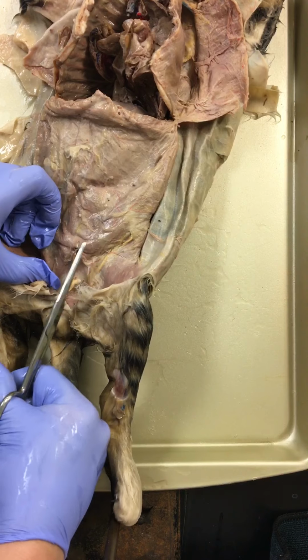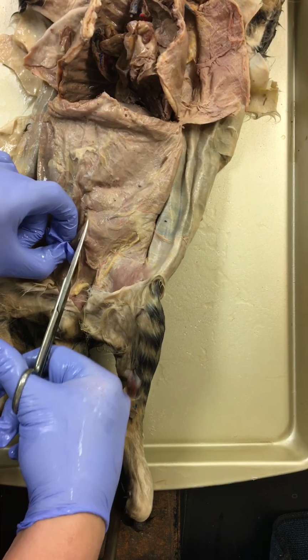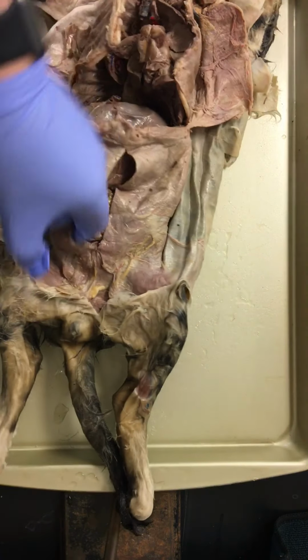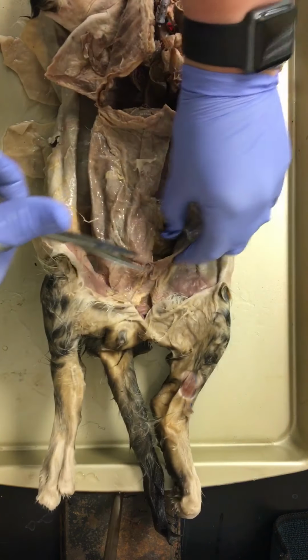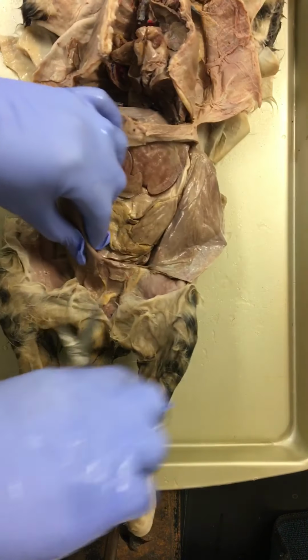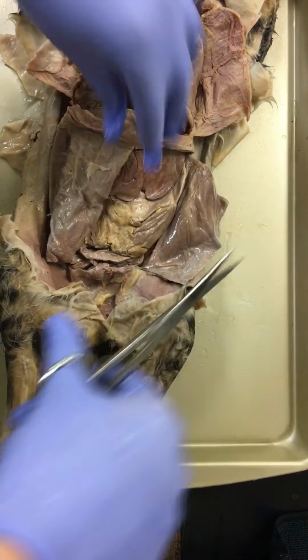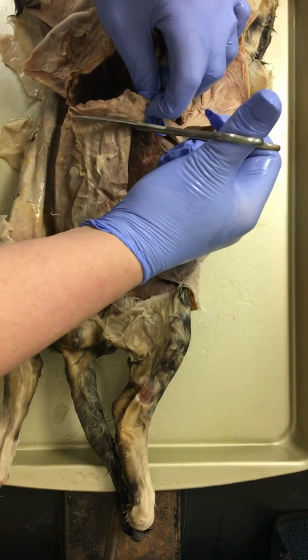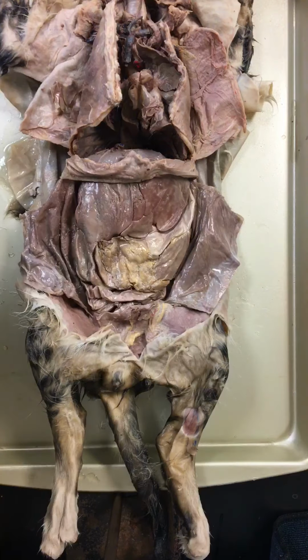And we want to go superficial so that we can get into the intestinal tract without damaging any parts to it. So we've got this right here. I'm opening up a Y incision, going down to the groin muscle on both sides, through that abdominal muscle, exposing the abdominal cavity of our cat. So, right here is our abdominal cavity.